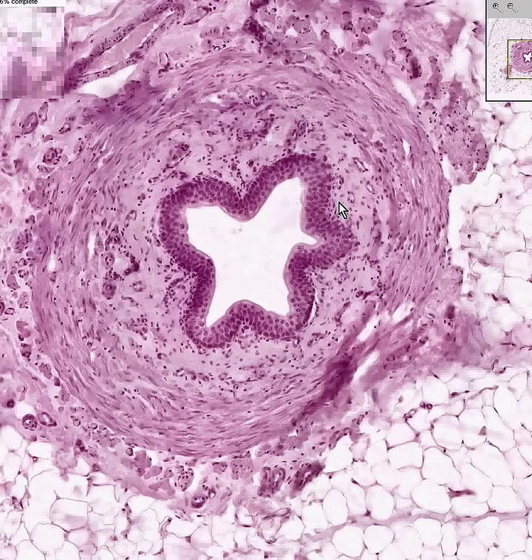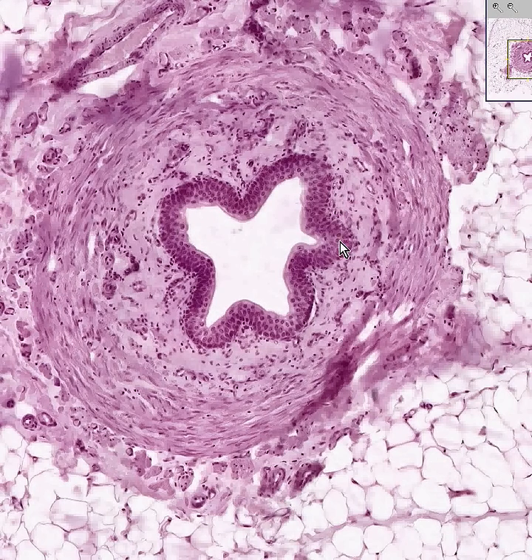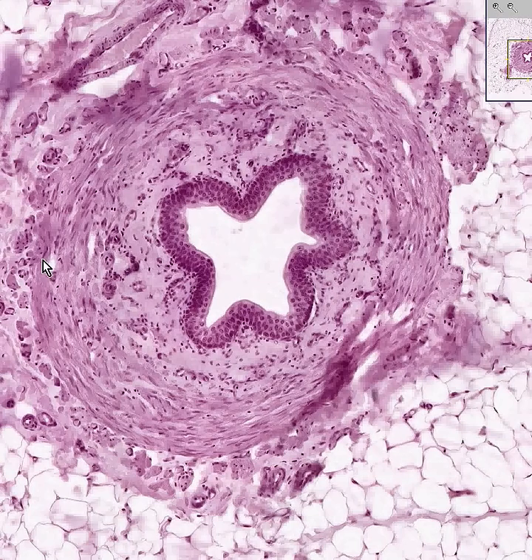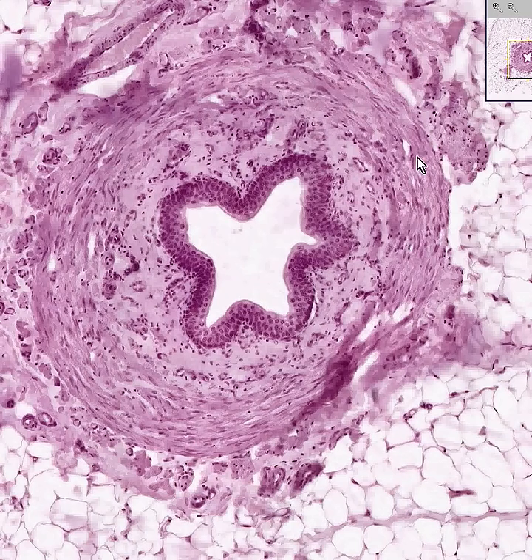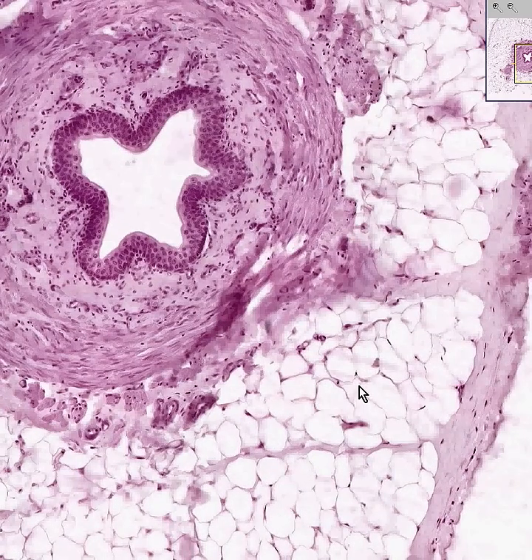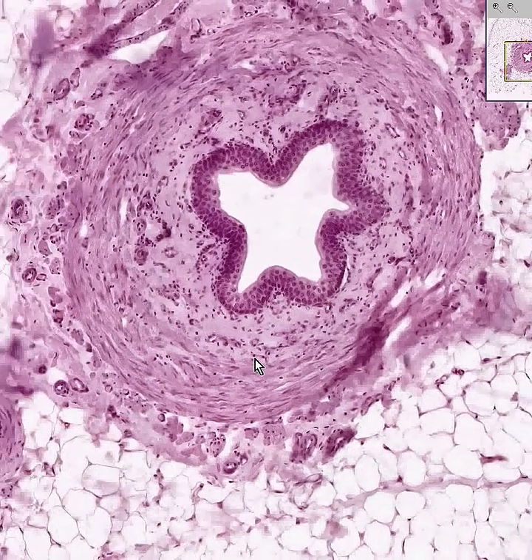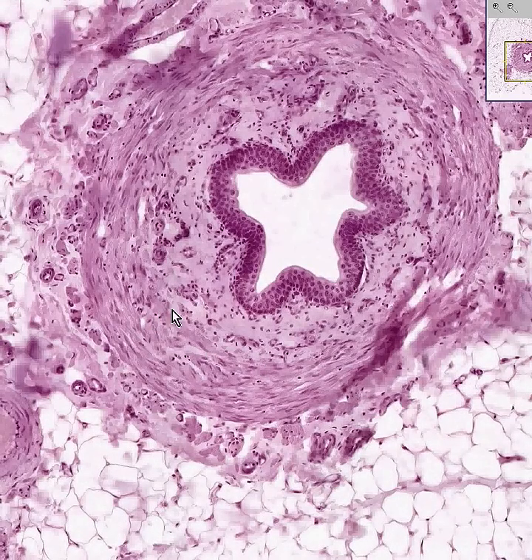A ureter is nothing more than a tube lined by transitional epithelium, or urothelium, with a little bit of loose connective tissue underneath and an array — chiefly circular — of smooth muscle bundles, then surrounded by connective tissue and fat. There is no serosa because the ureters are predominantly retroperitoneal, as is the kidney itself.